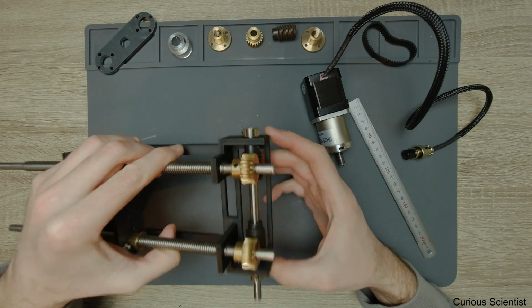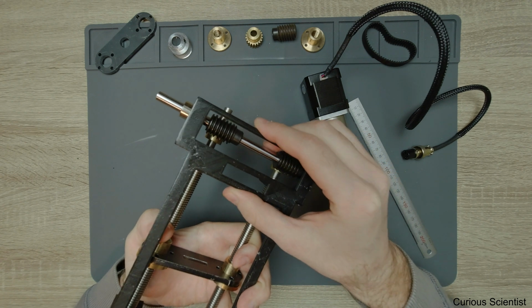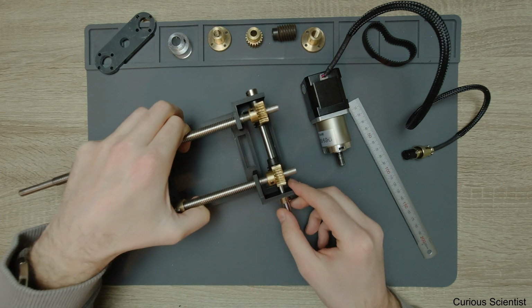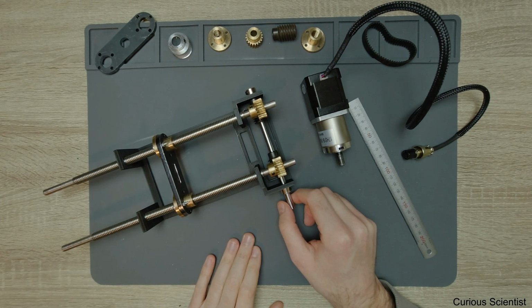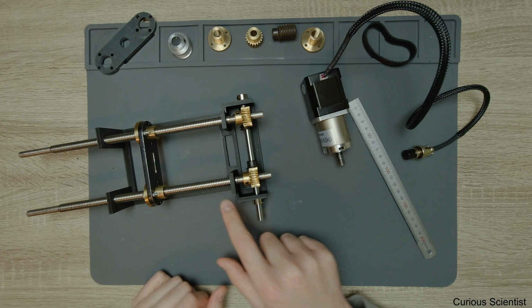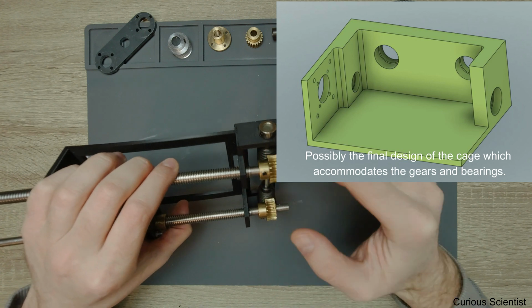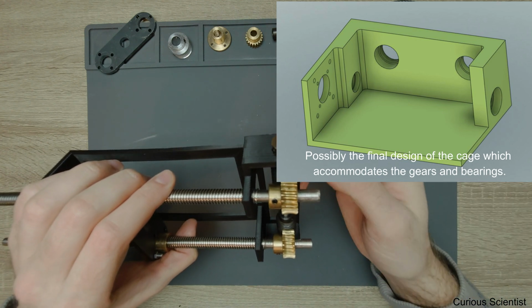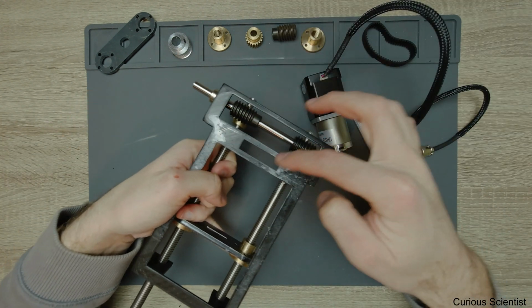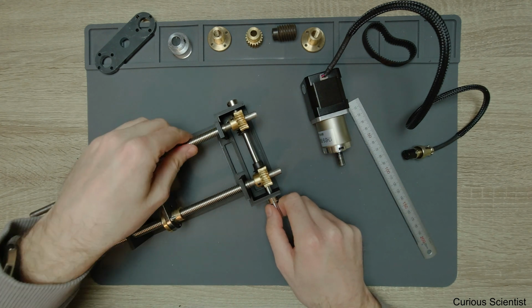But yeah, now what I wanted to show you is that I'm planning to do this thing. So I haven't stopped working on this, but I had some other problems which I had to figure out. So this is where we are now. So we have these worm gears and they are working nicely. So what I will do in the coming weeks or coming months, is that I will have a better drawing of this, because this is a prototype, so I saved a lot of material for the printing. You can see that I cut out a lot of material here and here as well, and here, just to save time and thread from the plastic.